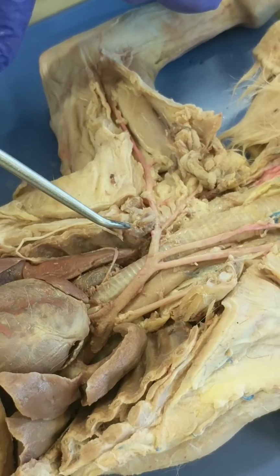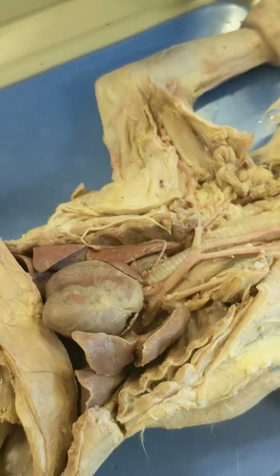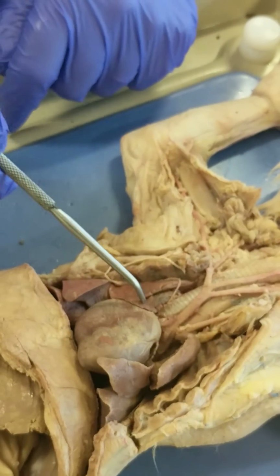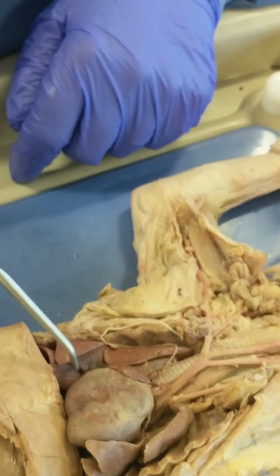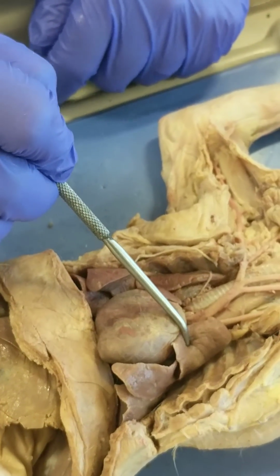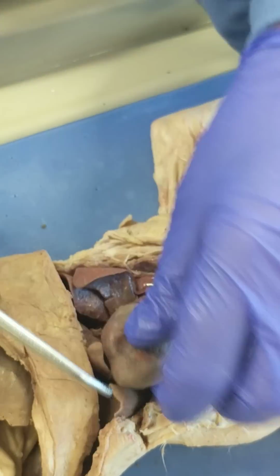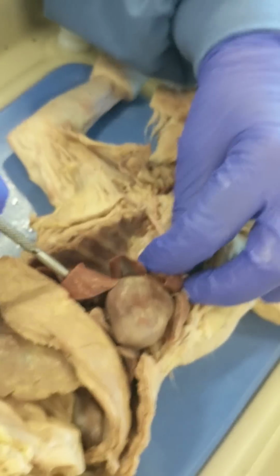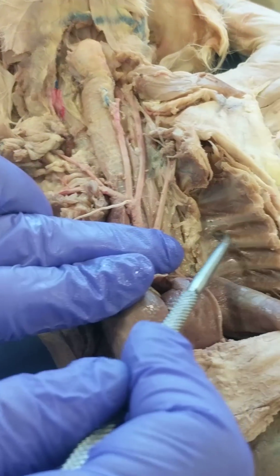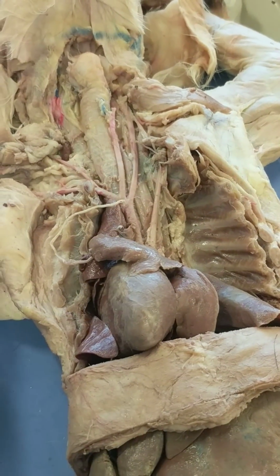That probably was the internal mammary that led to the ventral surface of the thoracic cavity, or wall of the thorax. So this is the heart, and the pericardium has been removed in its entirety. We do have lungs next to the heart that are covered in visceral pleura, and the parietal pleura stays adhered. I'm going to go on this side so Brian can get a picture of it better. See this shininess of the thoracic cavity. Maybe over here you can see it better. That's parietal pleura. It stays adhered to the thorax wall.